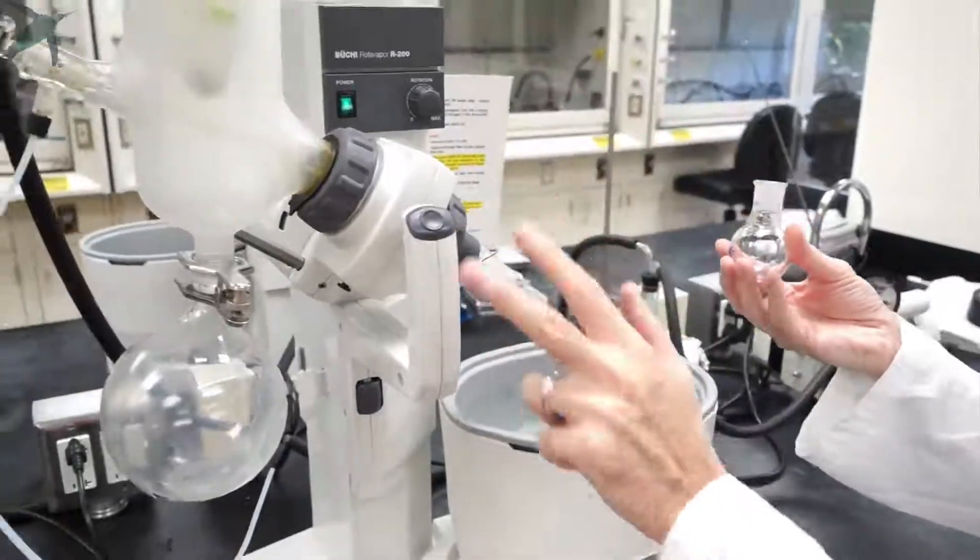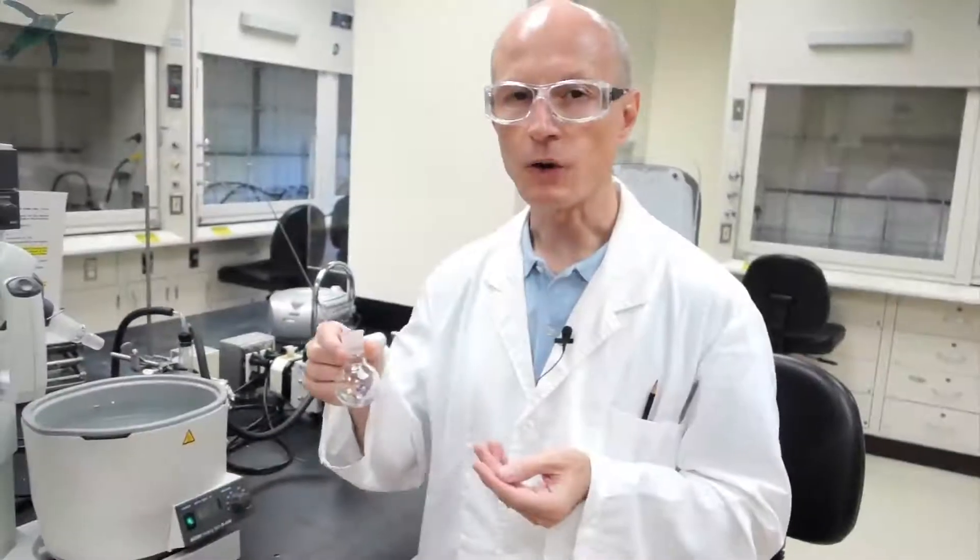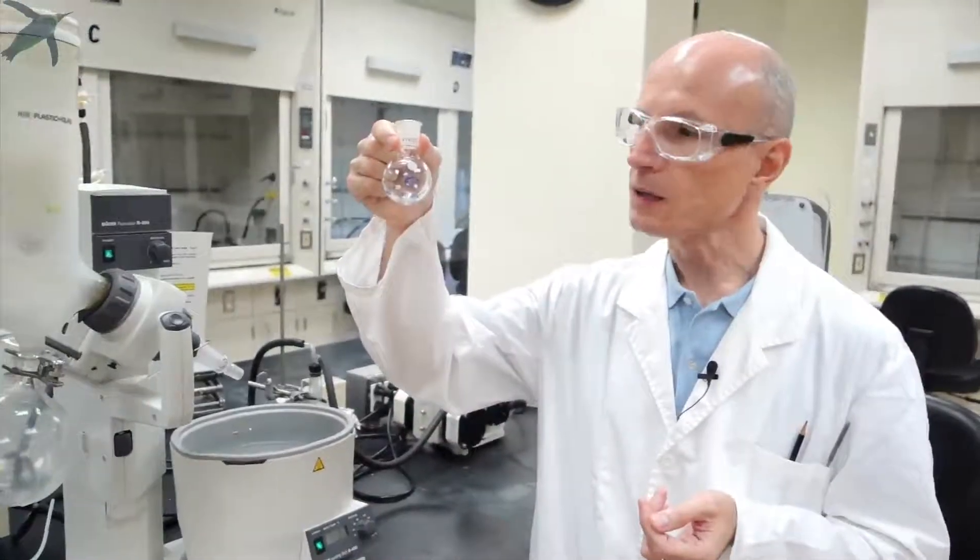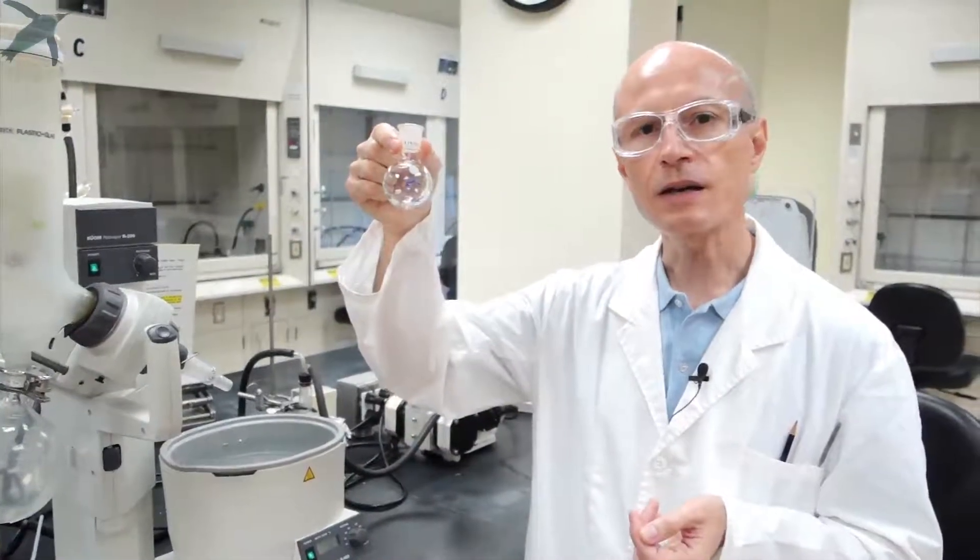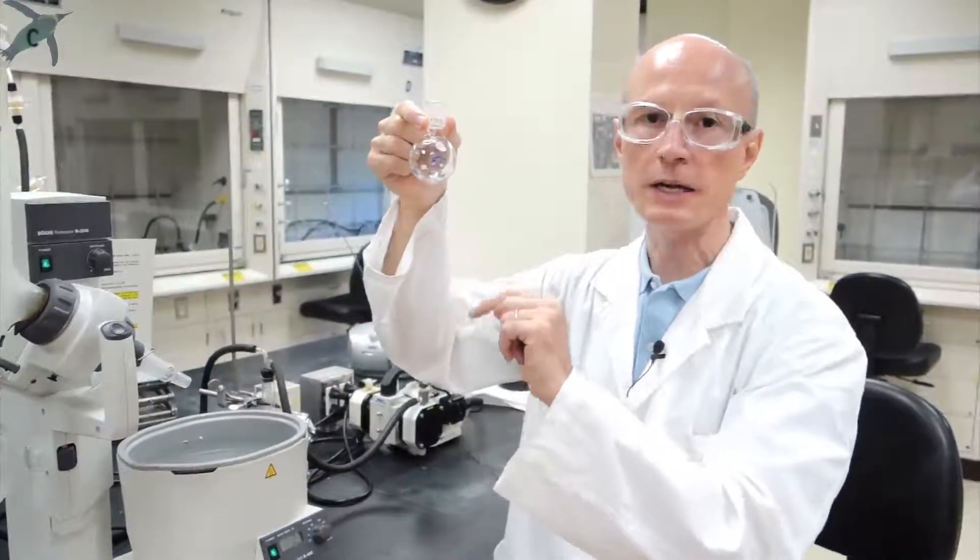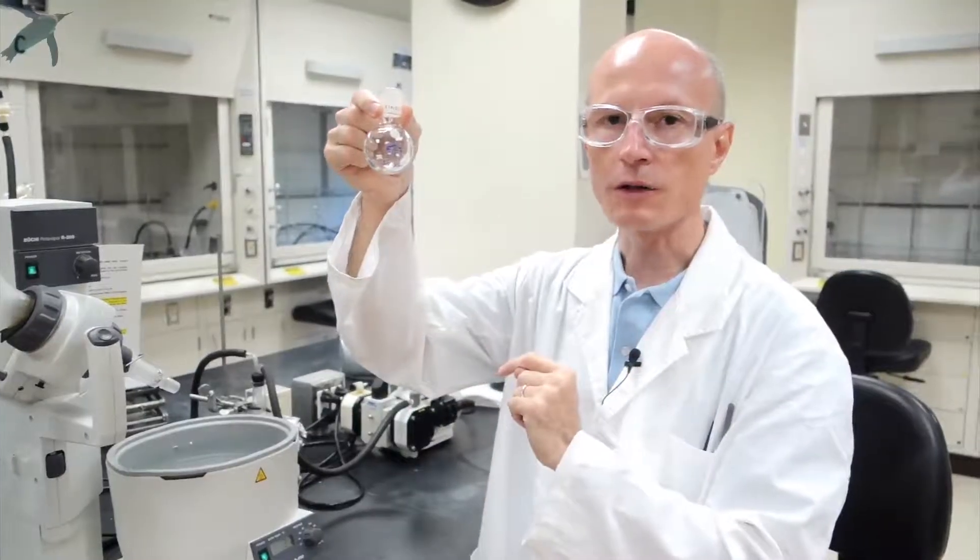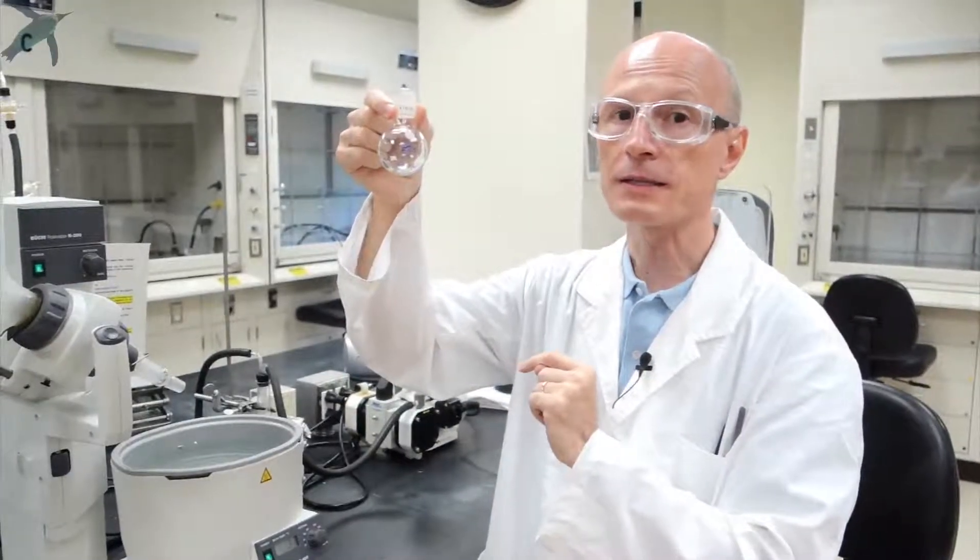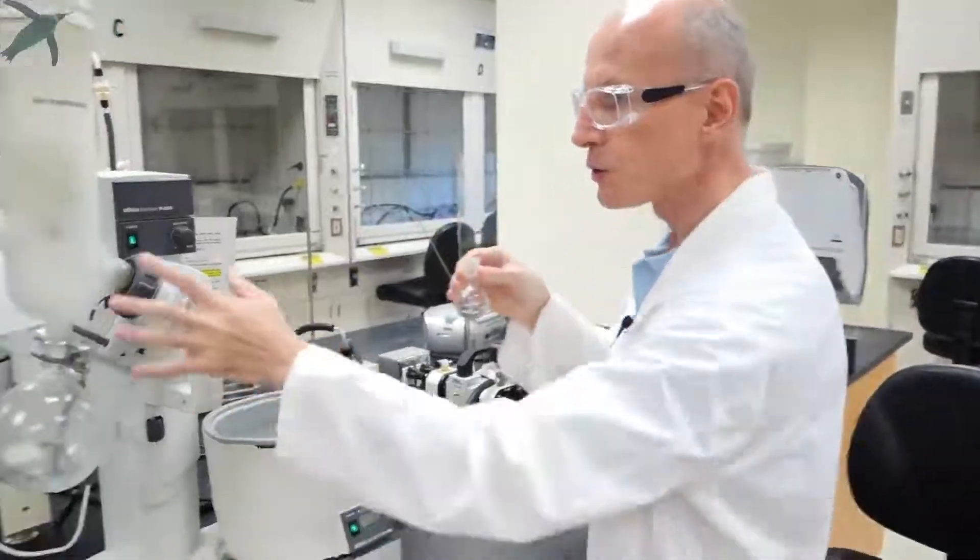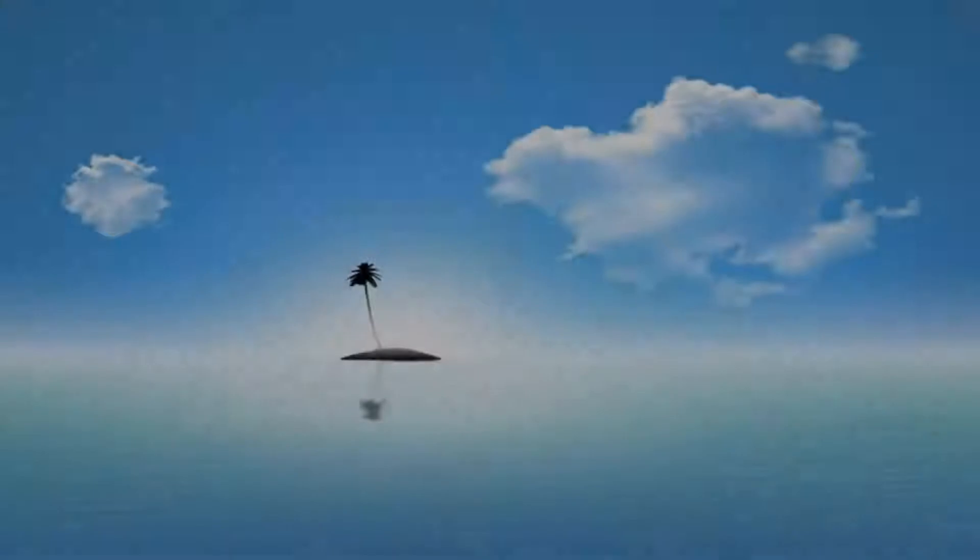You can leave the Rotavapor as it is for the next user. After you have removed all the solvent from your solution, the round bottom flask might look empty. It's not. If you have a liquid compound, you might have just a drop in here, which is spread around the whole wall, so you don't really see it even if it's in there. What you collect here is the solvent that is waste.